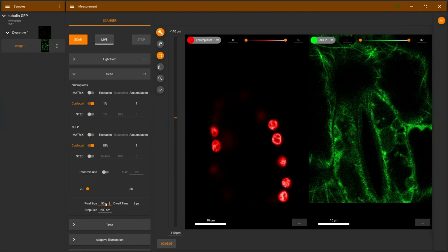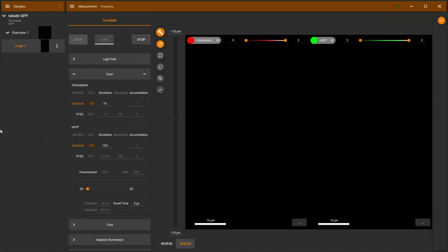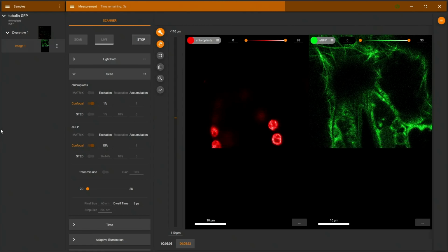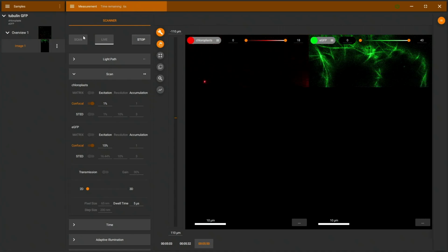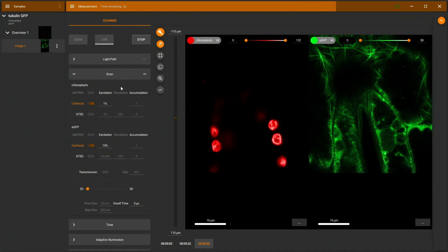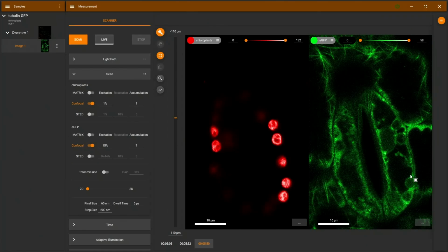Now, if I expand this menu, I can make the pixel size larger or smaller. And then scan again. And you can also adjust the dwell time here. Scanning now. That's a little bit faster. And I can see here my chloroplasts. And if I look into my GFP image, I can see a slight shadow here of the chloroplast fluorescence. I will make the dwell time a bit longer to get a little bit more signal, and then we'll see if we can really see some chloroplast fluorescence. Yeah, I think there's a very slight green fluorescence here, which is caused by chloroplast or chlorophyll fluorescence.